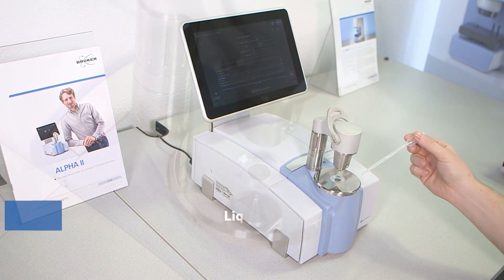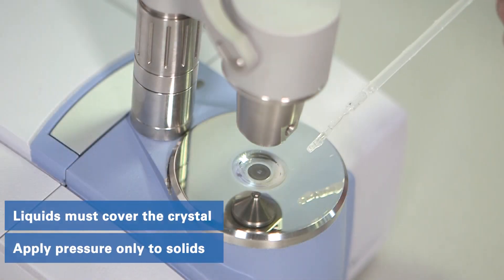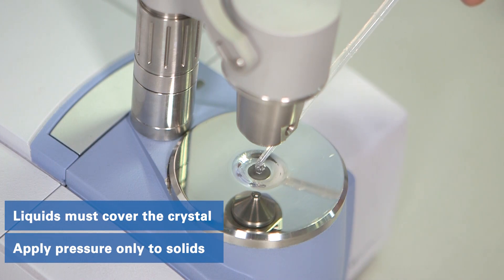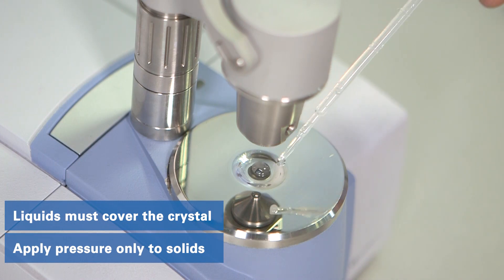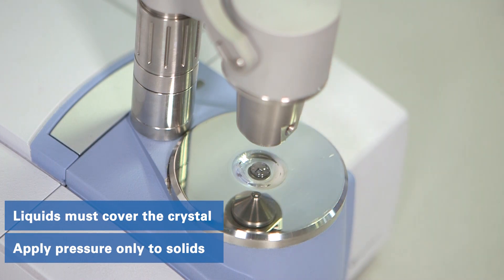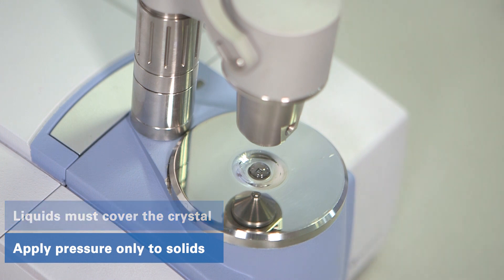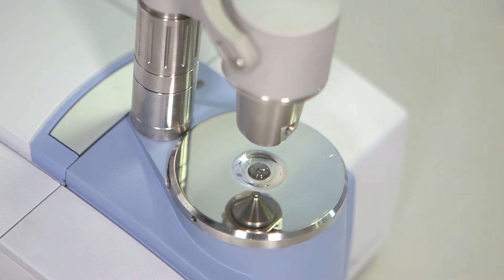When ATR is used, liquids and oils are directly applied to the crystal. Assure your sample covers the diamond entirely and apply the pressure stamp only for solids.